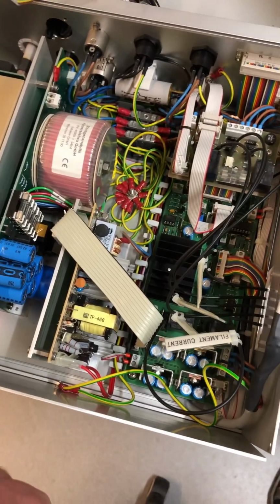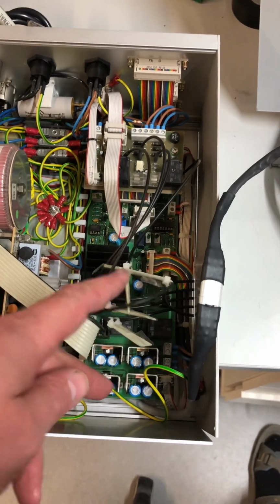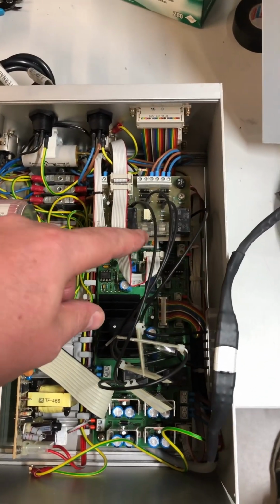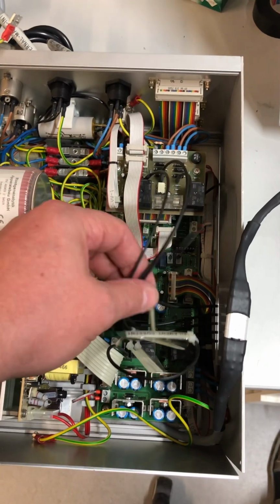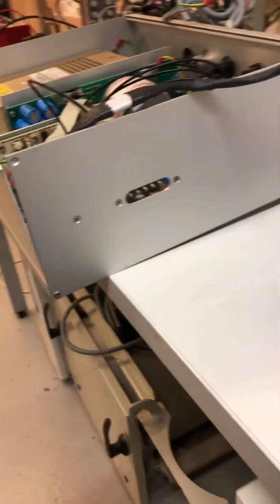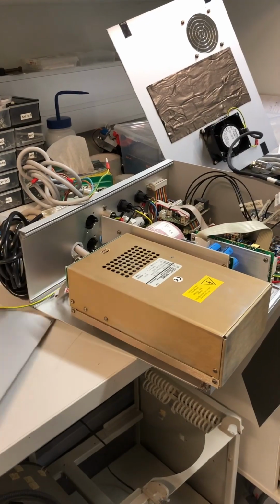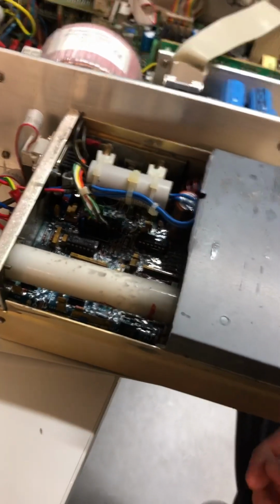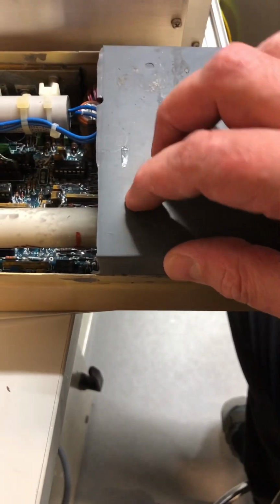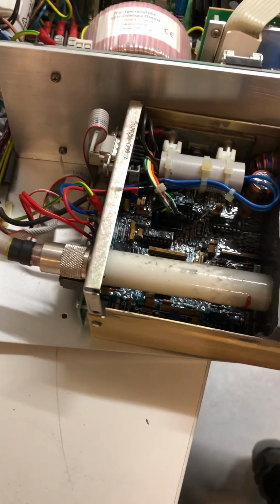I think it's for interlocking and control. Here is the board, many power regulators, and what is cool is that we have optical waveguides for indication. This is a technique used in high voltage electronics. Easy to take apart 19-inch rack enclosure. The high voltage part weighs about 3 kilos, and it's put in silicone. The high voltage output connector is a long tube.